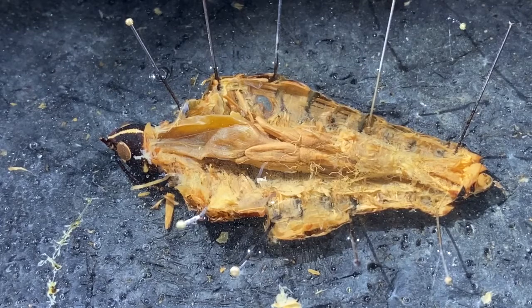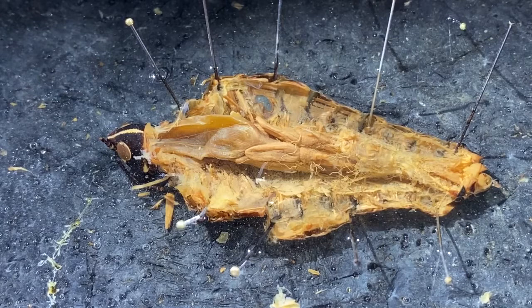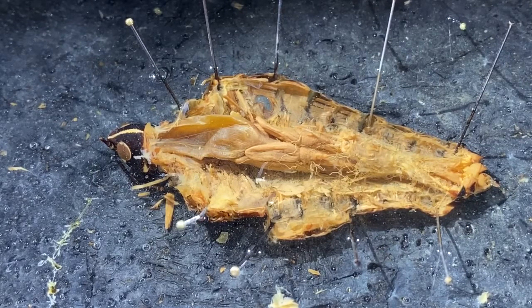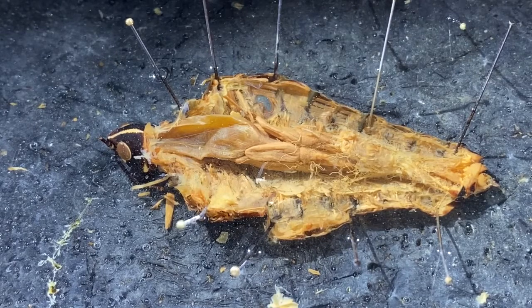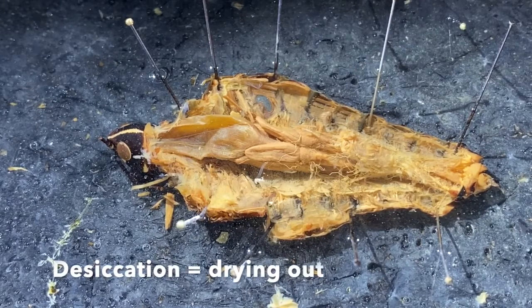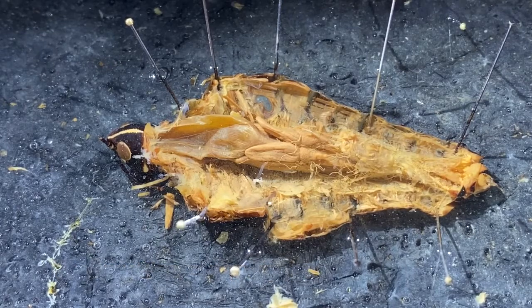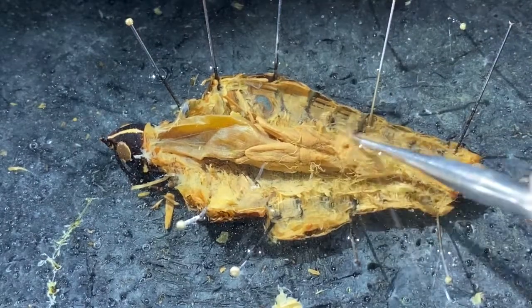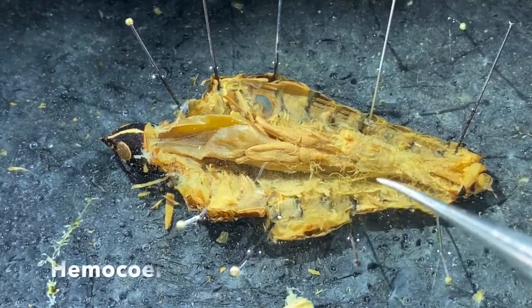And uric acid is moderately expensive to produce energetically, but what it allows is these animals to retain the vast majority of their water. And if you are a small animal like this and you live on land, desiccation is a real problem. So this helps them to reduce or minimize their desiccation. And so that's what all these thread-like structures are surrounding and coming out into this body cavity, the hemocoel.